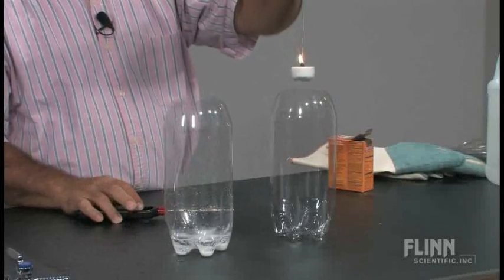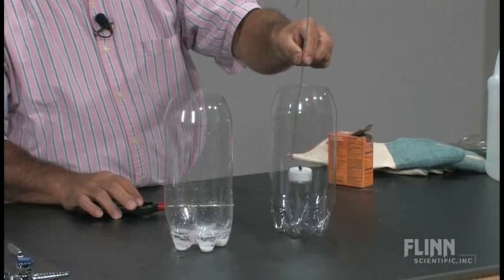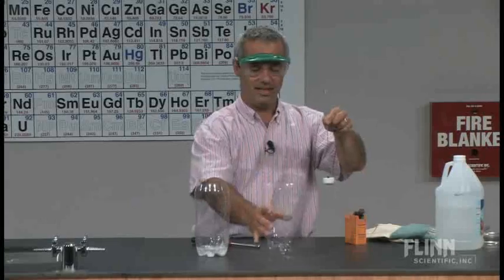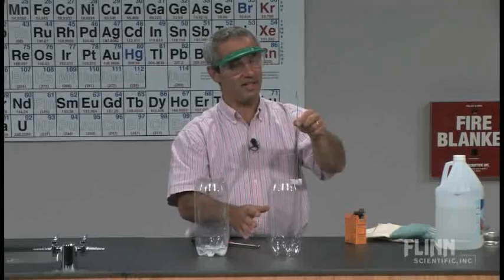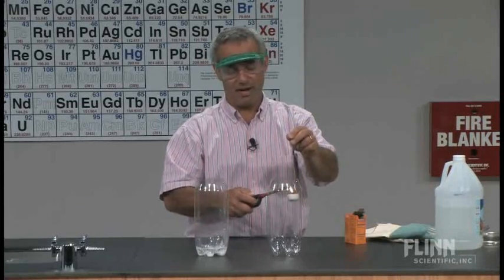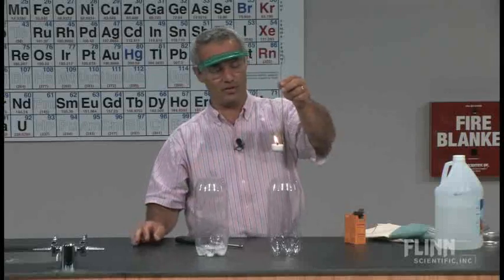We have this thing empty of CO2 or full of air. Remember I dumped it but I didn't dump it all out. By the way if I just left it in there diffusion would eventually take over and probably 10-15 minutes from now there'd be no CO2 left.